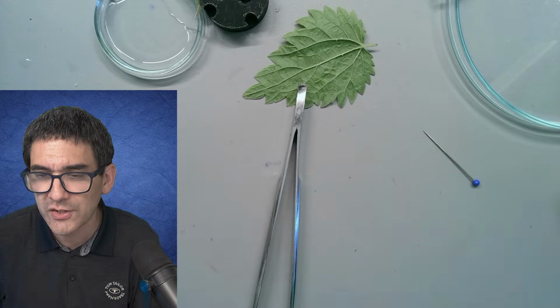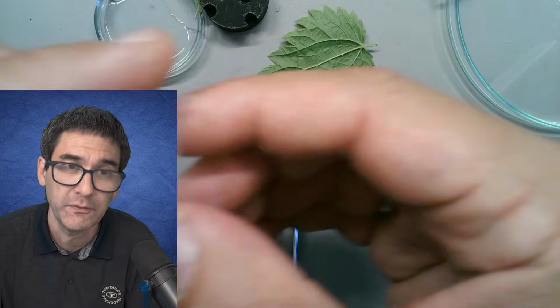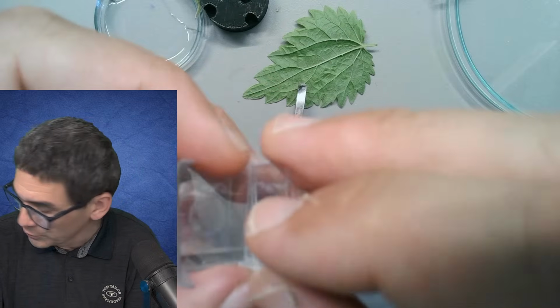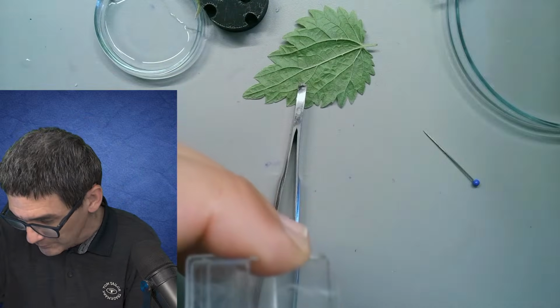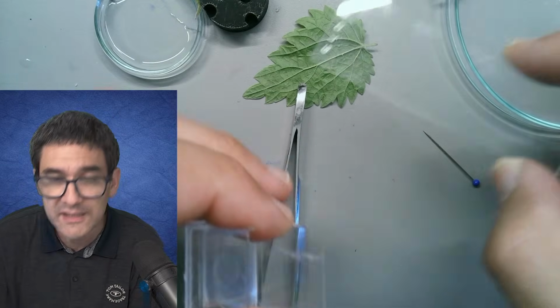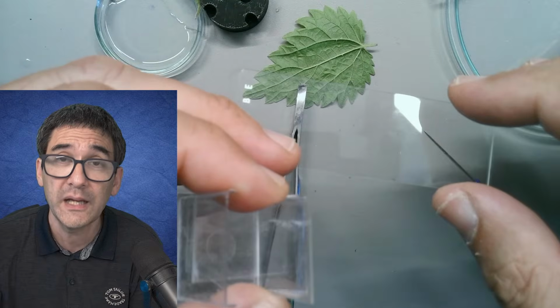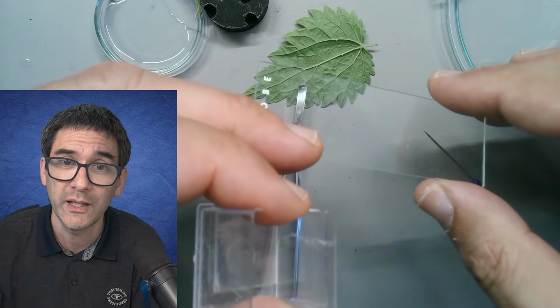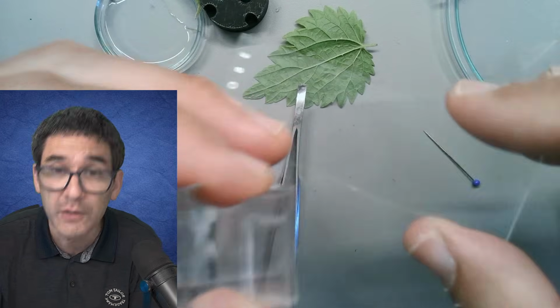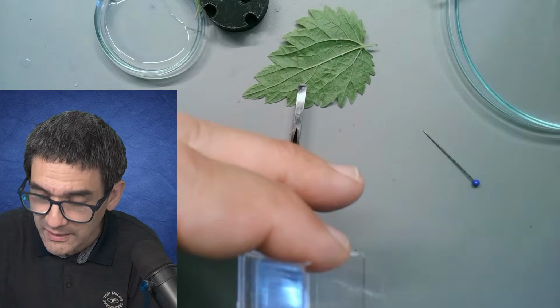Do you run the cover glasses also in the dishwasher? The short answer is no, because they're going to be flying around. However, what I have done is the following, and I'm also doing that with the other slides. I don't put them directly into the dishwasher, but I put the slides into a plastic box with hot water and then some dishwashing powder. While I don't use the dishwasher itself, I will use dishwashing powder, and I found this to be very effective. And then of course I'm rinsing each slide individually.